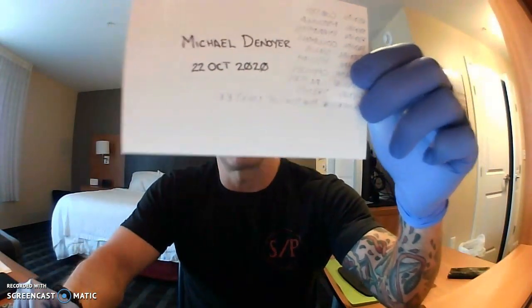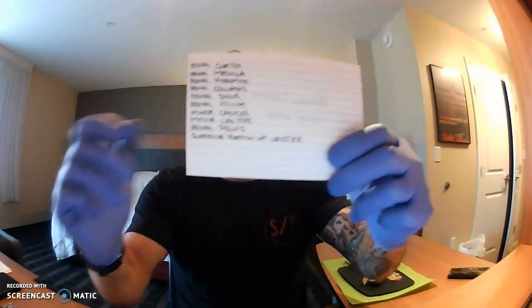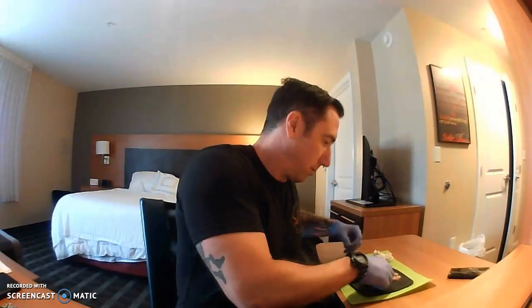It's the 22nd of October, 2020, and today I'll be dissecting a sheep kidney and going over the major portions of it. On the back of my card, I wrote down all the major anatomy portions of the kidney to ensure that I don't miss any of the prompts. So let's go ahead and just dive right into it, I guess.